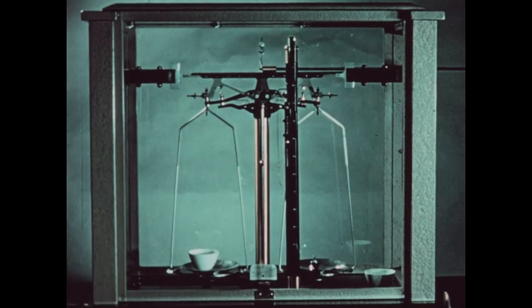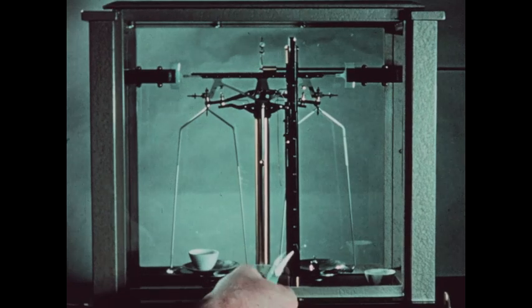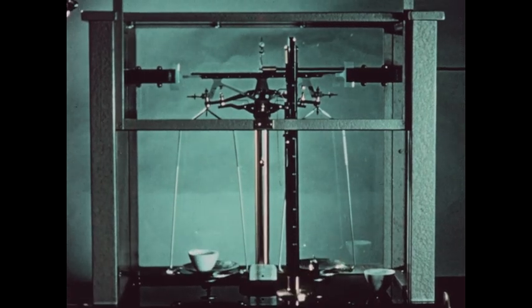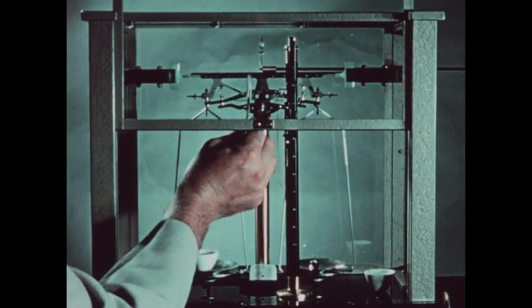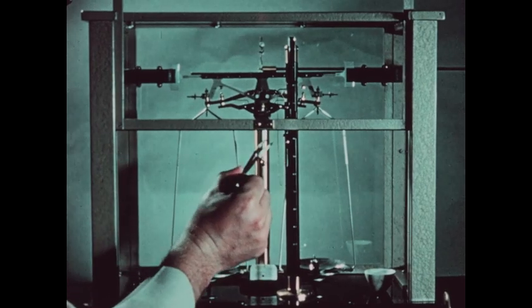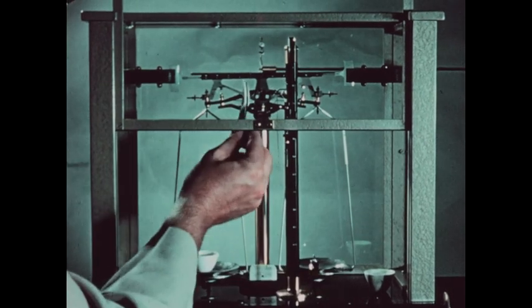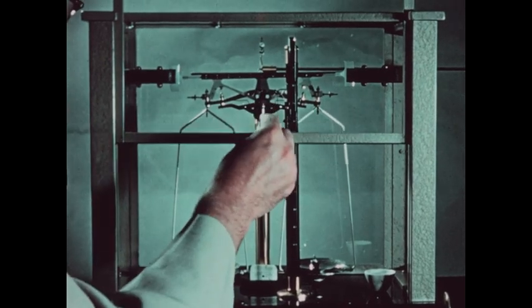The crucible on the left pan of the balance has been weighed. The crucible is sitting on the pan on the left; on the right-hand pan we have a 10-gram weight. On the beam we've placed a rider at the four-tenths of a gram mark, and we've lowered the chain so that the total weight of the 10-gram weight, the four-tenths gram rider, and the chain exactly balance the weight of the crucible.